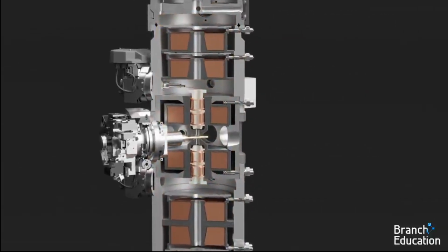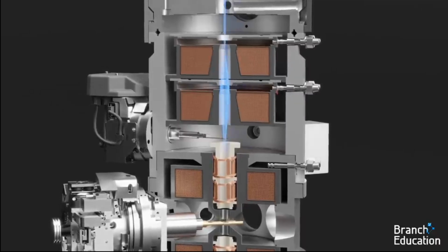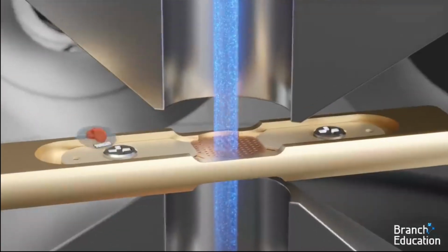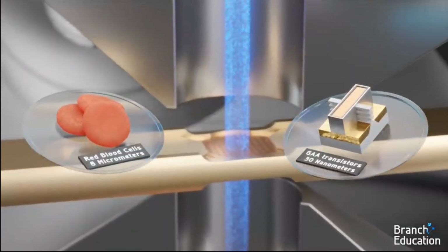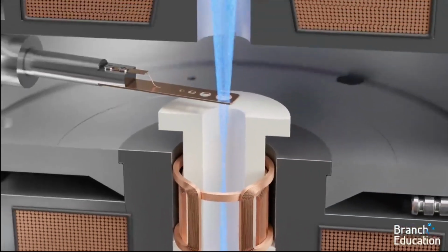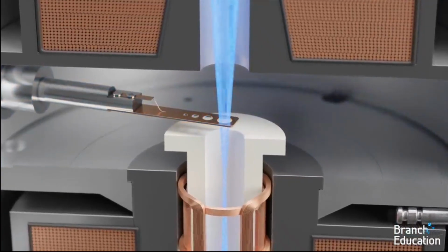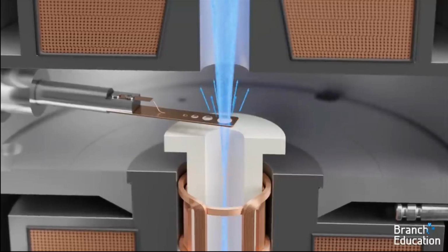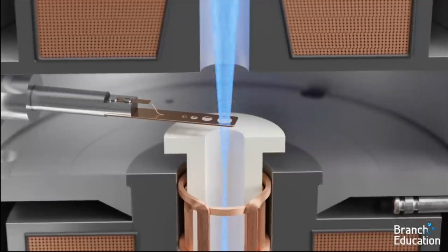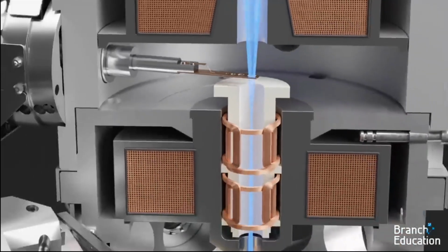The role of the condenser magnetic lenses is to focus the electrons from the source and project them onto the sample, so that they illuminate an area the size of a micrometer to several nanometers, depending on the desired magnification. Additionally, the microscope uses apertures, or holes, placed in the path of the beam to filter out any electrons that are fanning too far from the center of the column, or optical axis, resulting in electrons more parallel to one another before they hit the specimen.